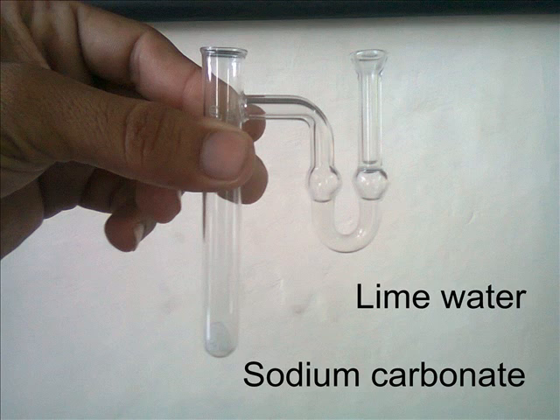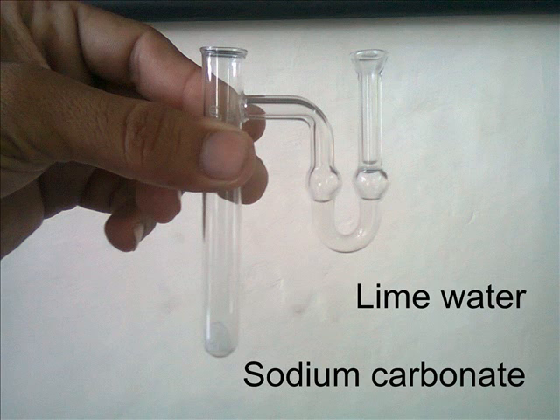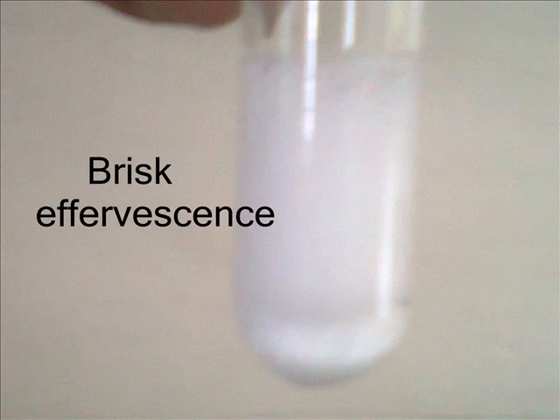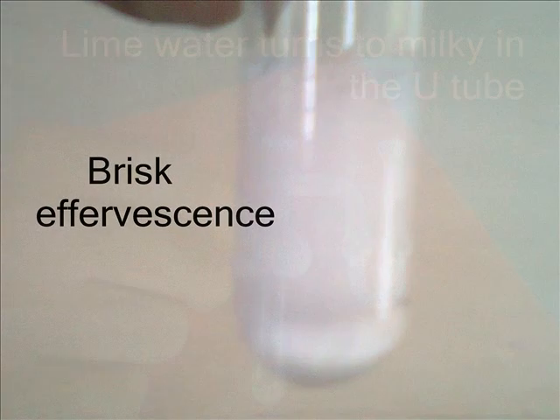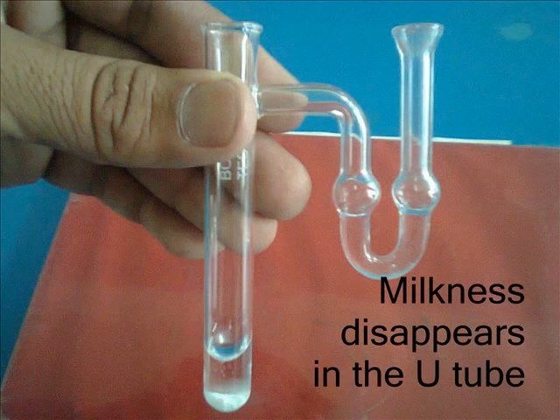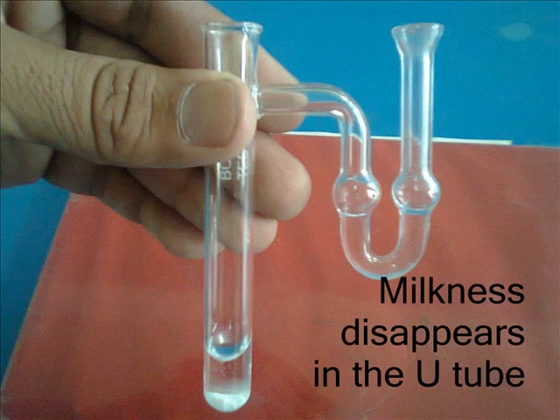Acids release carbon dioxide gas on reaction with a metal carbonate like sodium carbonate. Lime water is taken in a U-tube and sodium carbonate is taken in the test tube. When acid is added to the sodium carbonate, carbon dioxide is released with brisk effervescence. When carbon dioxide gas is passed through lime water, it makes it milky due to the formation of calcium carbonate.